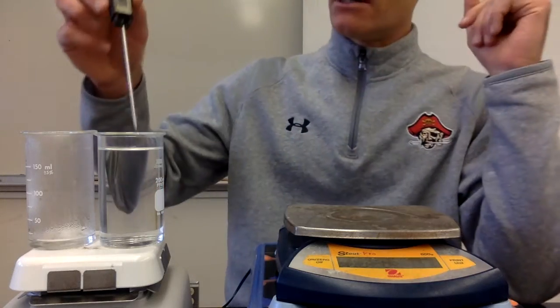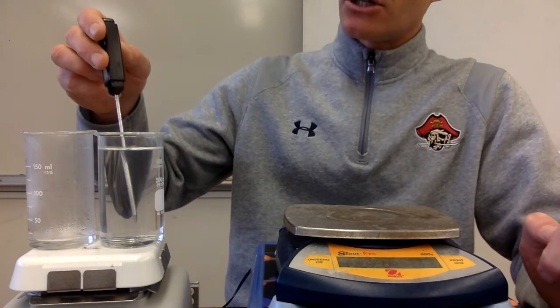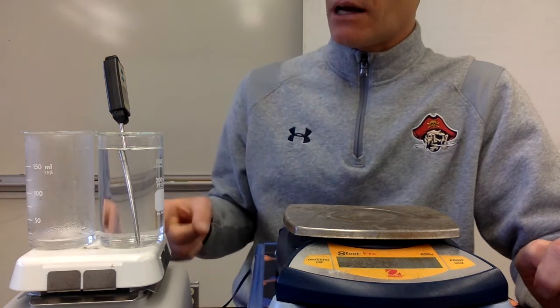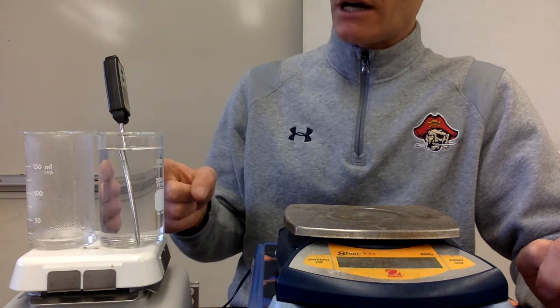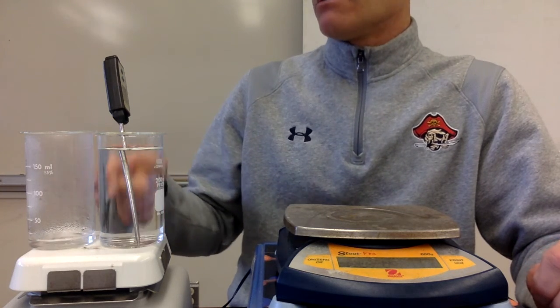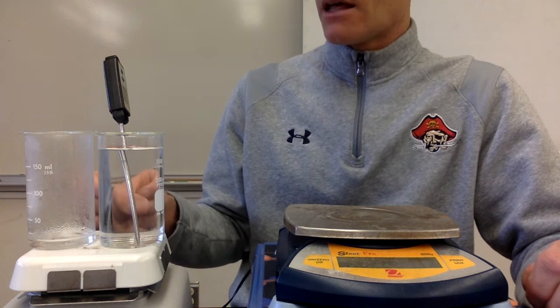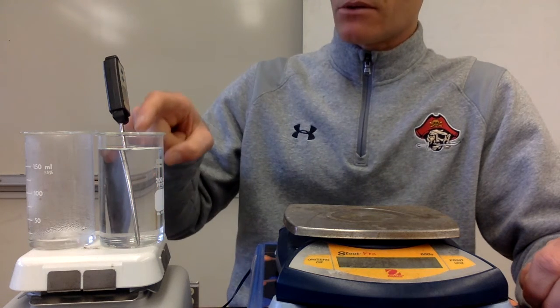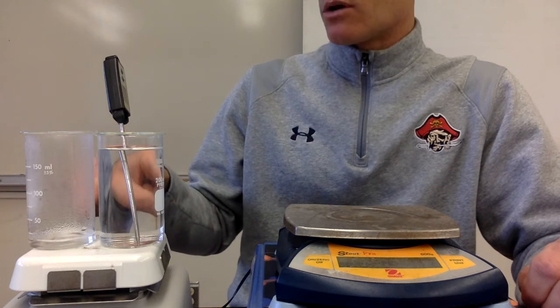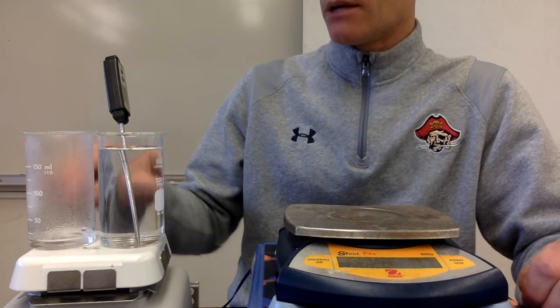And so by measuring the temperature change, initial and final, for this one, and since we know the mass of this one, we can figure out how much heat this water absorbed, and we'll say that that's equal to the amount absorbed by this beaker. And so if we know how much was absorbed by this beaker to heat that water, we'll know how much heat was absorbed by that water to change it from a liquid to a vapor.